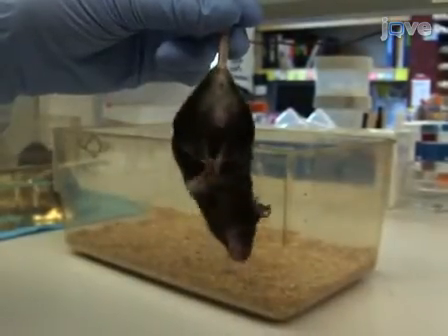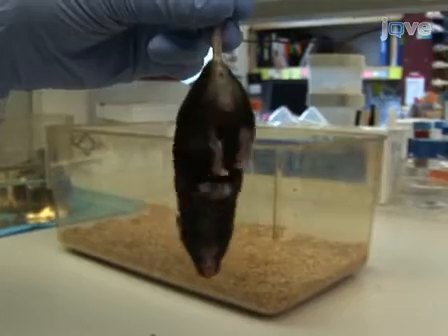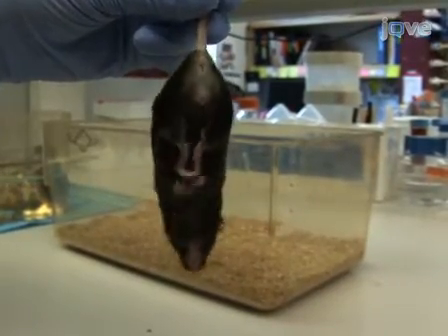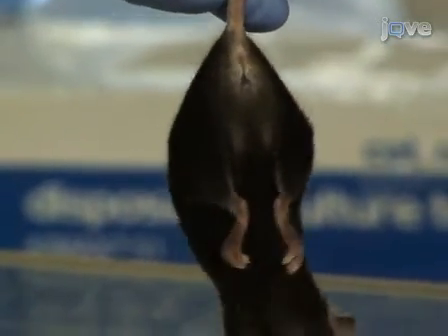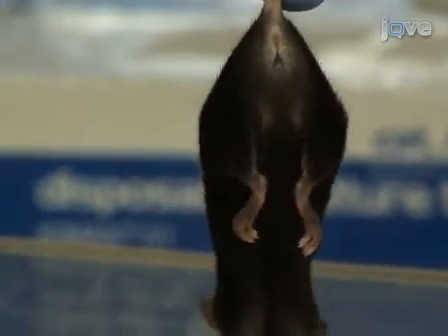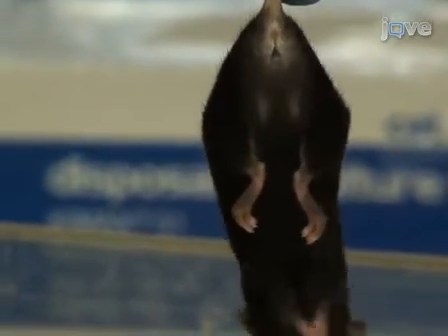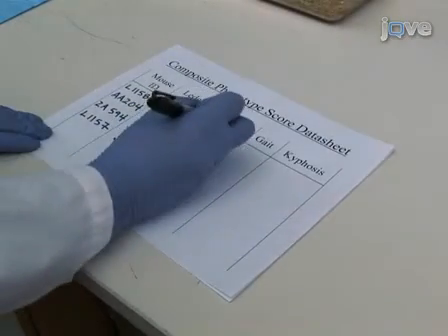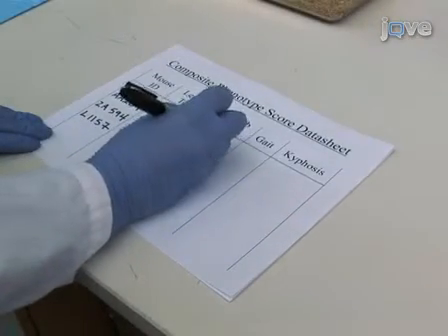If both hind limbs are partially retracted toward the abdomen for more than 50% of the time suspended, it receives a score of 2. If the hind limbs are entirely retracted and touching the abdomen for more than 50% of the time suspended, it receives a score of 3. Conduct the test three times and record the hind limb clasping score.